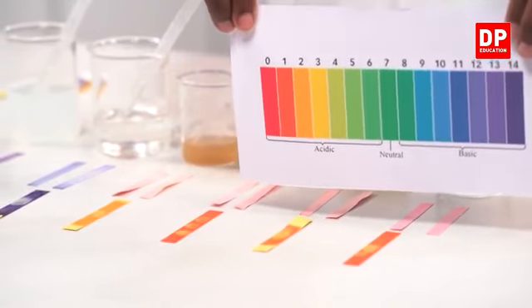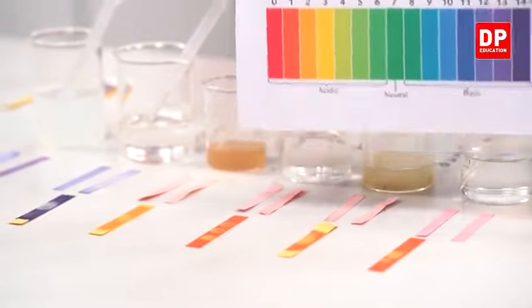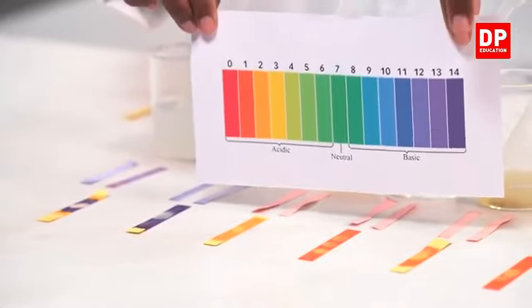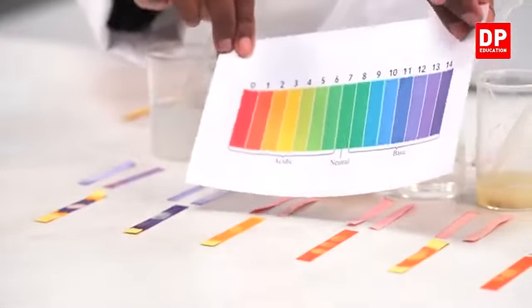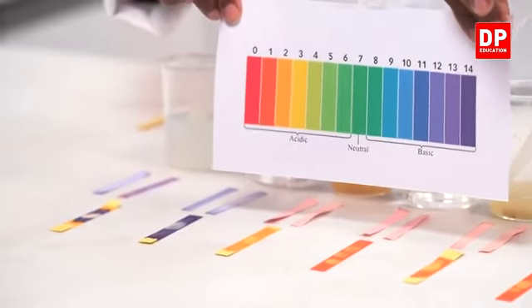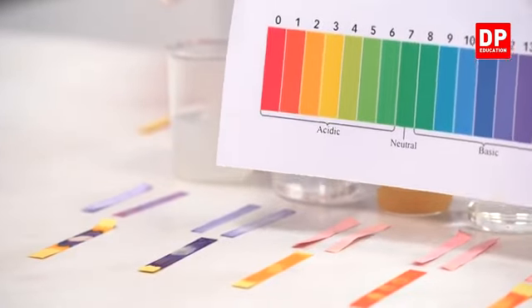So it's almost towards pH 2. So now can you all get an idea? Then I'll bring it closer to the vinegar. Now see the color. This is almost 3. Now the color is different. Different from sulfuric acid and hydrochloric acid. So the pH is 3.